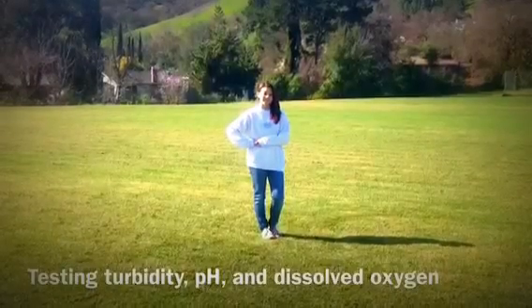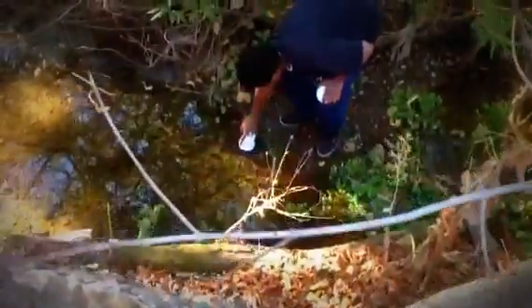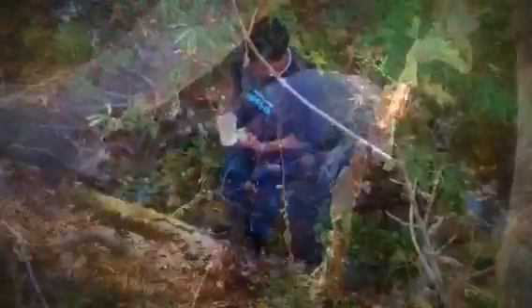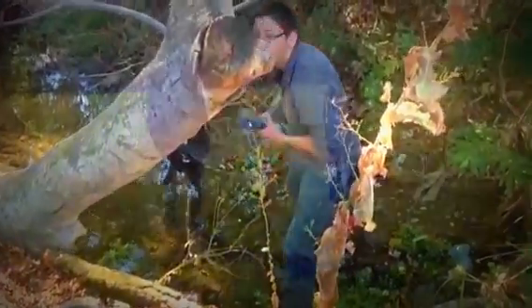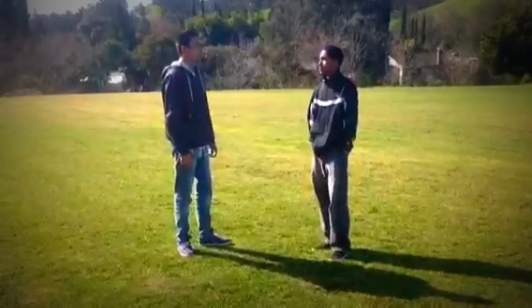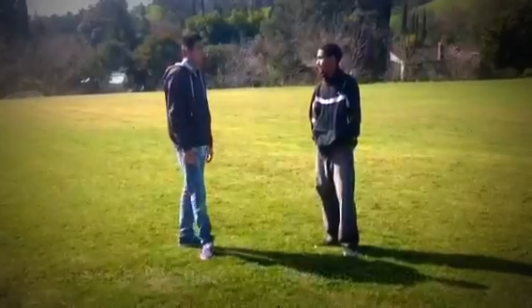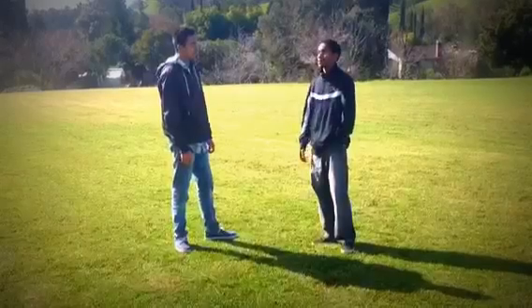So we've been testing Grayson Creek for turbidity, pH, and dissolved oxygen. We just came back from Grayson Creek, and my friend here, Amjad, just finished testing the water. So Amjad, what were the results? Sergio, the temperature of the water was about 10 degrees Celsius, which is about 50 degrees Fahrenheit. So how did you test the water? It's pretty simple actually. All I gotta do is get a thermometer, just put it in the water, send it out.